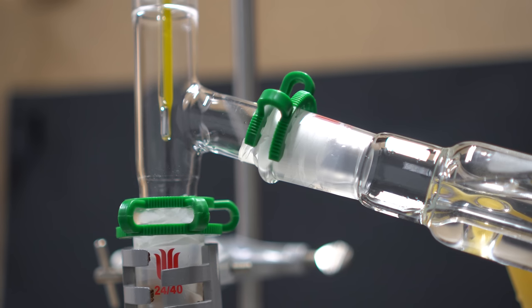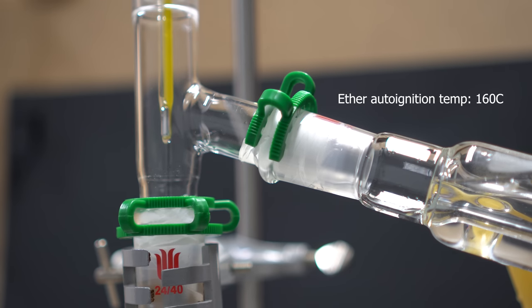You can see in the reflection that I came by to attach the water pump to the condenser. Here after I turn on the water pump you can see that everything has come over nice and pretty relatively fast.